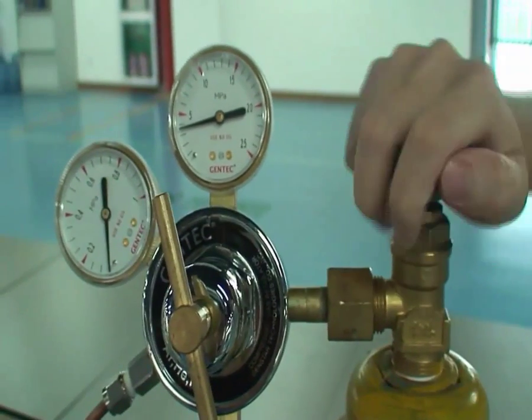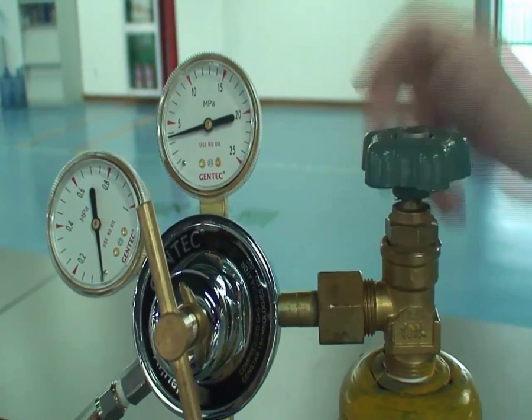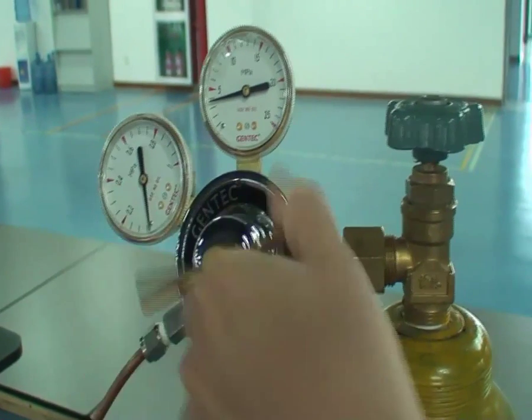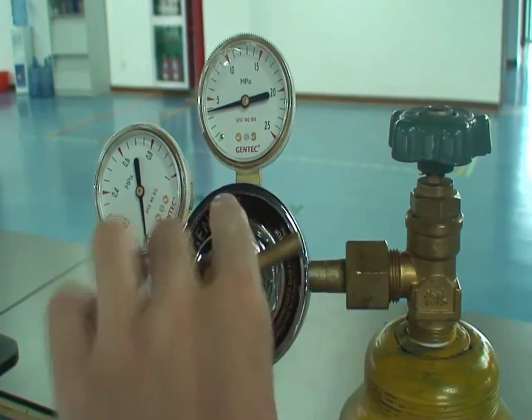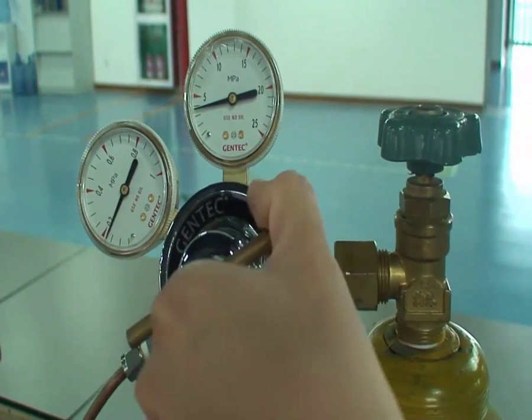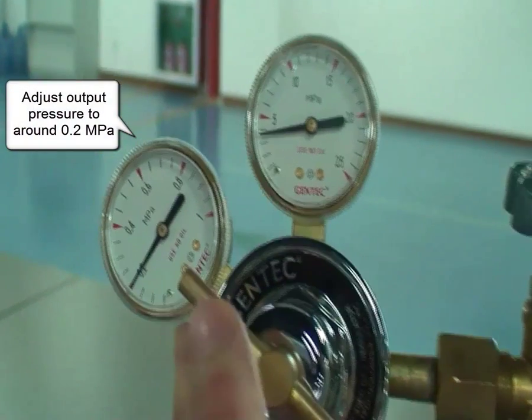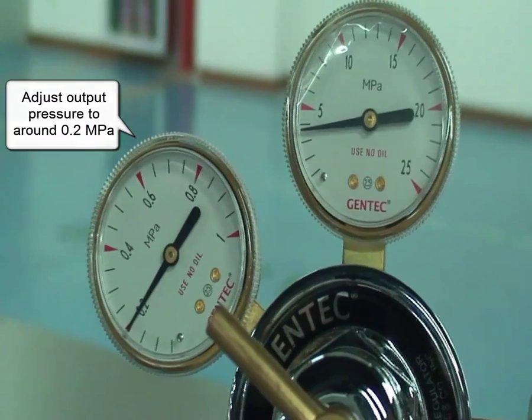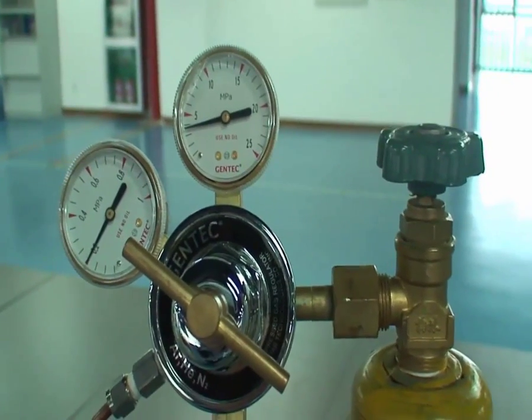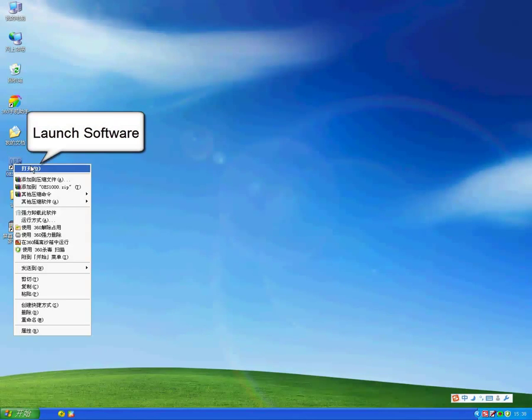Before the test, turn on the argon gas cylinder. Turn on the main valve first, and then adjust the output pressure to around 0.2. Launch the software.